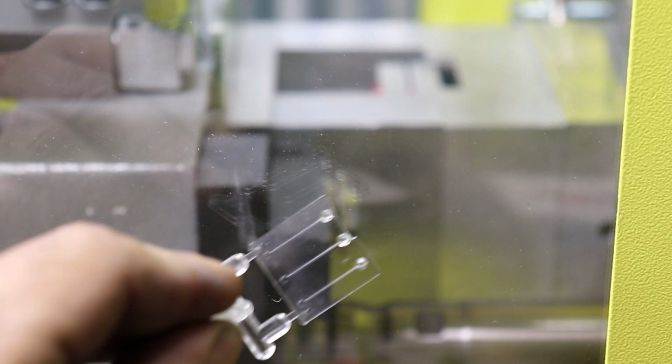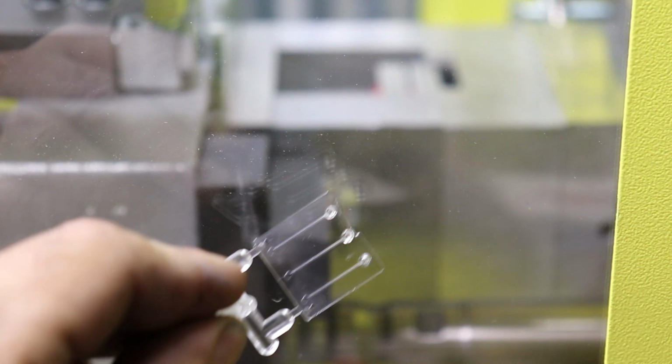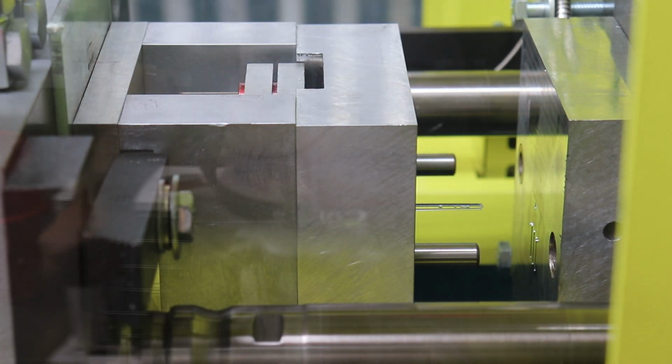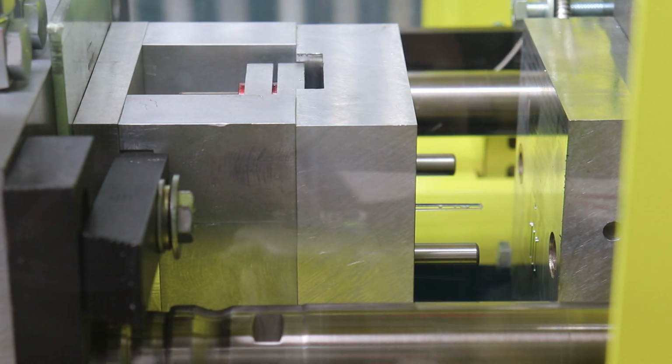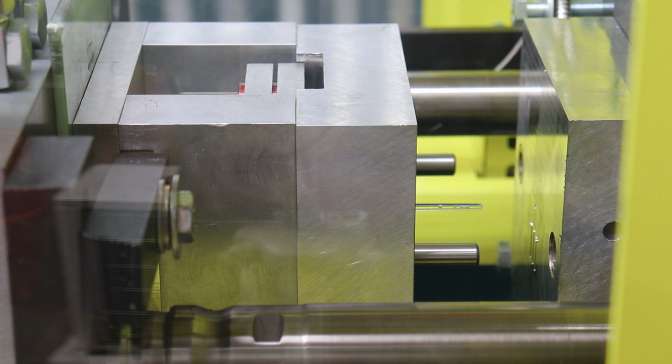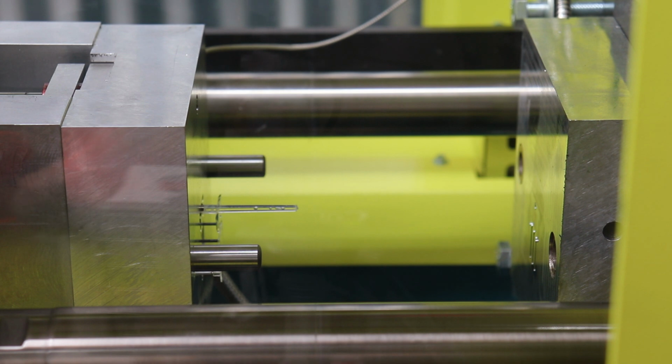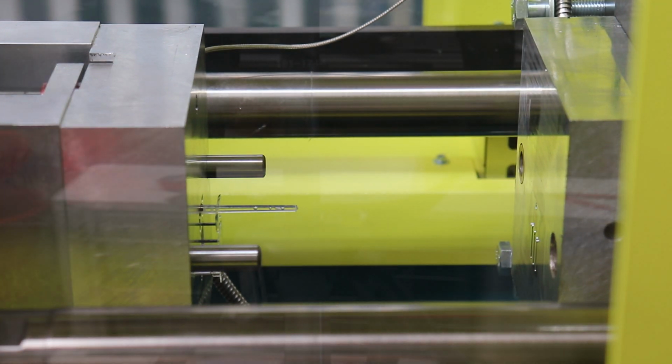So this is the first part. I don't know if you can see it. Well, let's see this guy eject. Uh-oh. Okay, well that one didn't come out. So much for being overly optimistic. So I hit the manual button when that part didn't fall out. So now we're going to open the mold up and I'm going to eject forward. We're going to figure out why it's not wanting to come out.